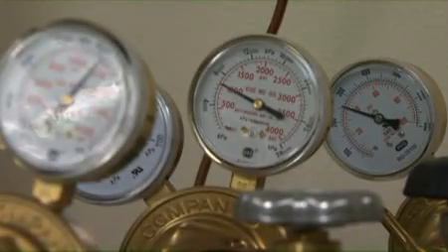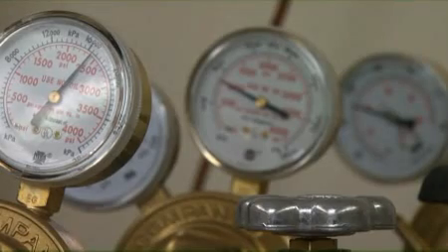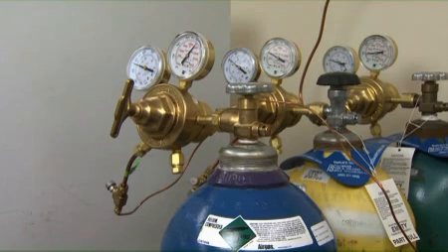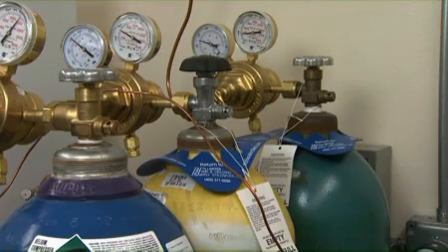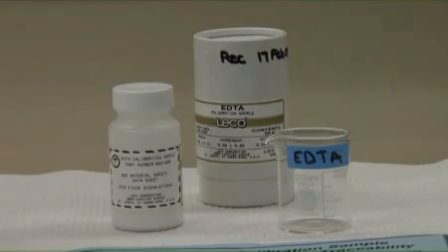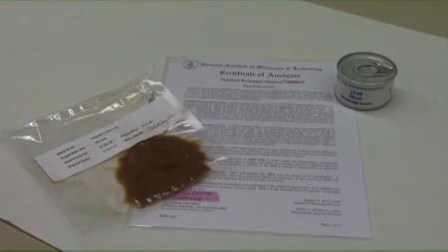There are 3 gases that are necessary for the LECO TruSpec to operate properly. Oxygen, ultra-high purity grade, or UHP, is the combustion gas. Helium, ultra-high purity grade, or UHP, is the carrier gas. And breathing air operates the autosampler. For a standard, use the EDTA calibration sample supplied by LECO, calibrated and traceable with a minimum purity of 99%. The EDTA standard must be recalibrated annually, or a new standard must be ordered unless the nitrogen result remains within plus or minus 1% of the manufacturer's reported value. The use of a control sample or a standard reference material is strongly recommended.